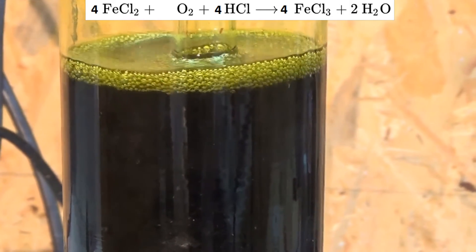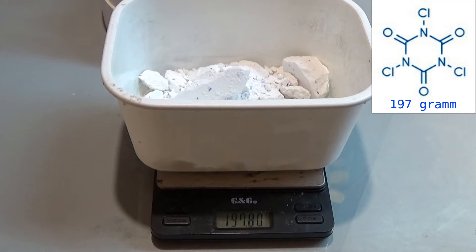But then I got a gift: 20 kilos of hydrochloric acid. Hooray.